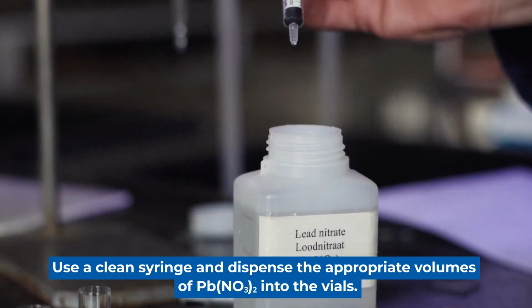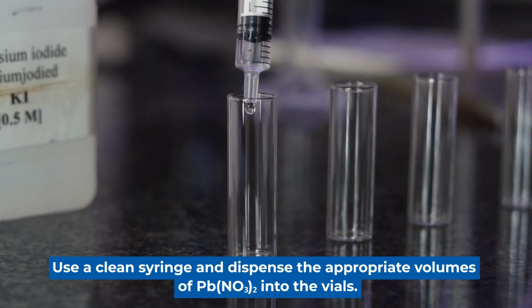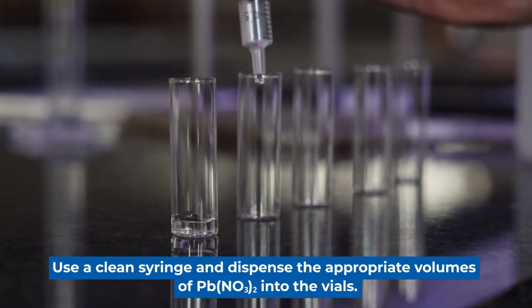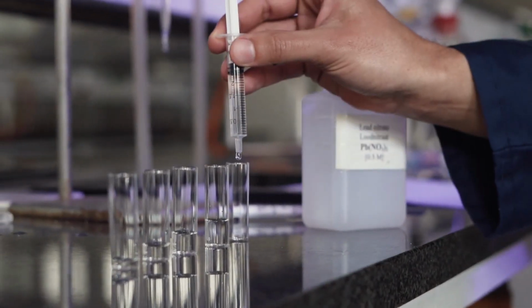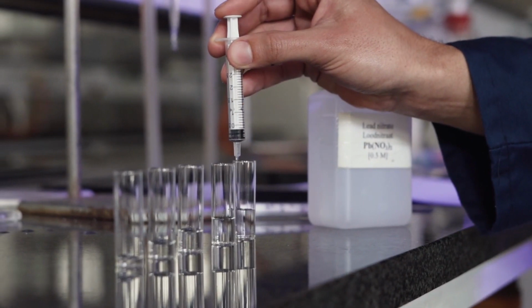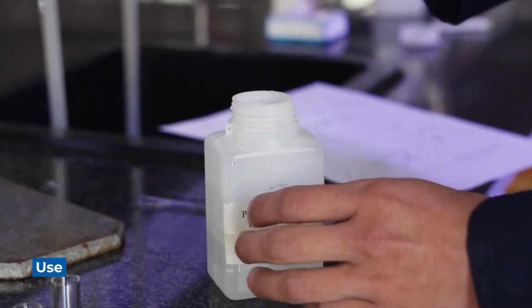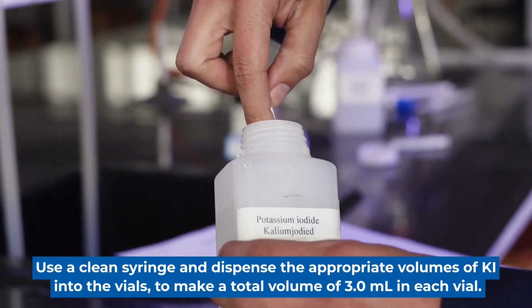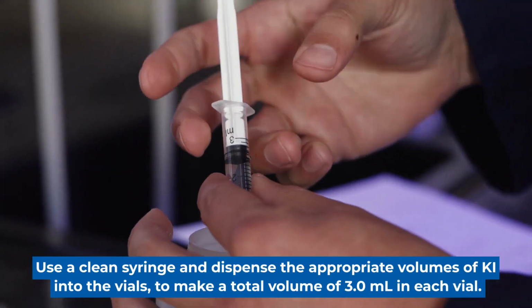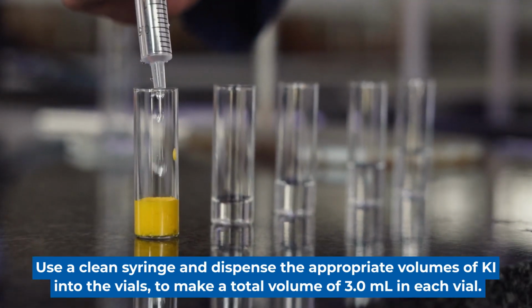Add the appropriate volumes of lead nitrate into the vials using a clean syringe. Using a clean syringe, we will now add the appropriate volumes of potassium iodide to each vial to make up a total volume of 3 cubic centimeters.